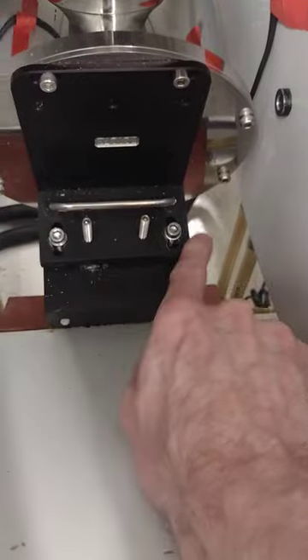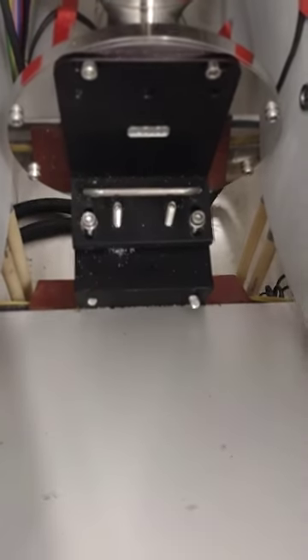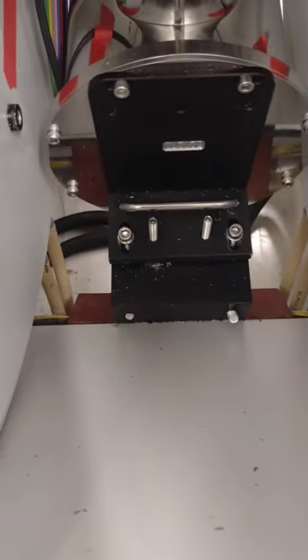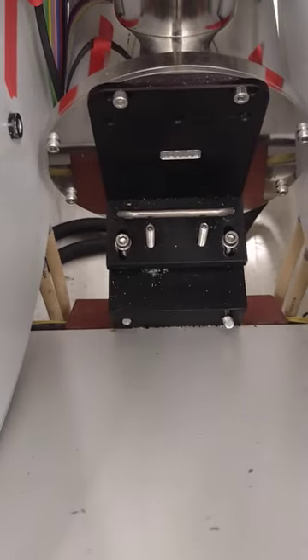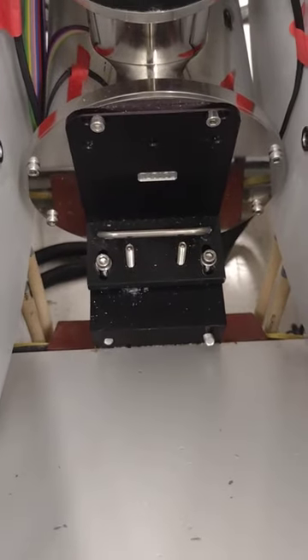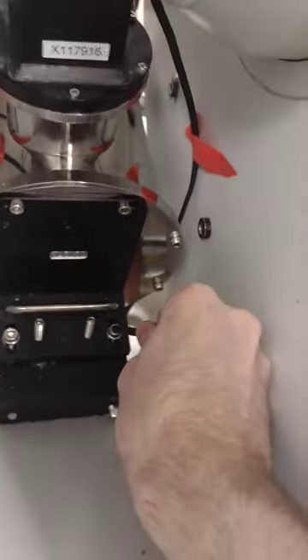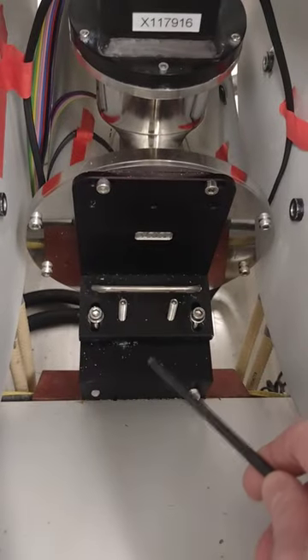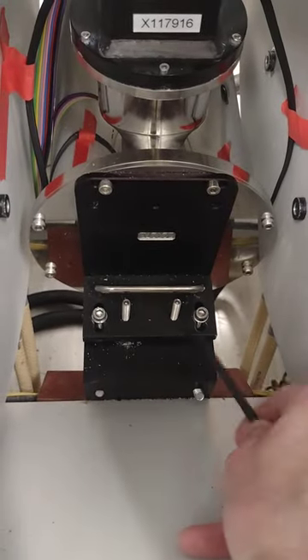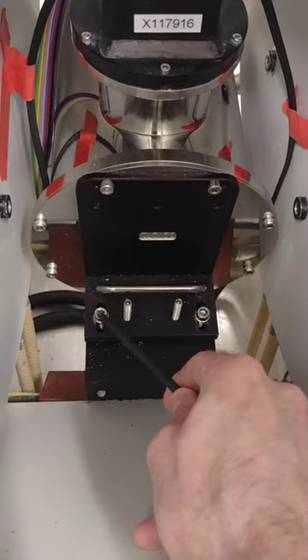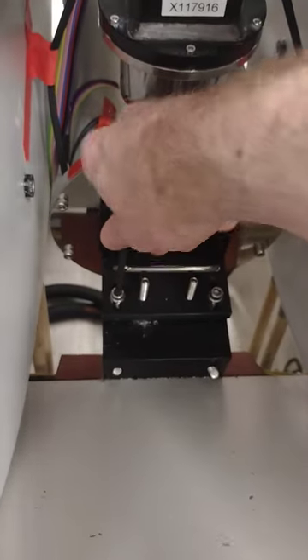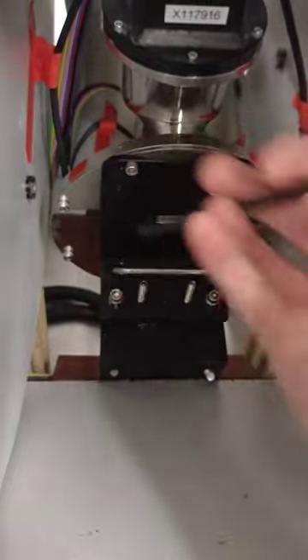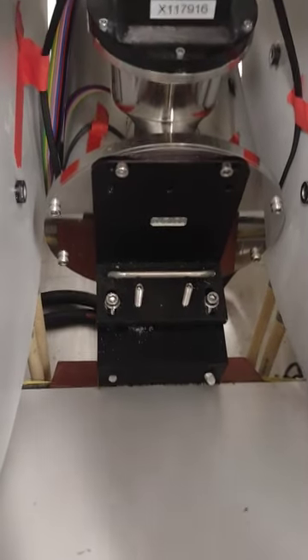This bolt and this bolt stabilize the cryostat in place. They hold the cryostat down against the magnet so it doesn't vibrate. I'm just testing, yeah, this is a 5 millimeter Allen key bolt right here and here. So you'll loosen these. You can take them all the way out.